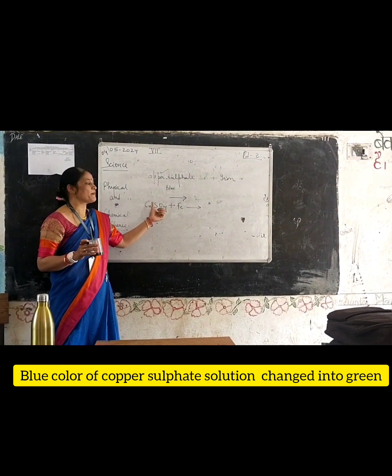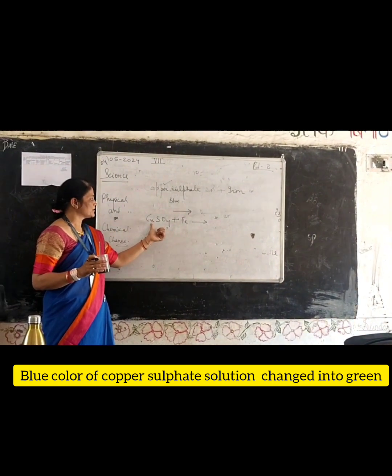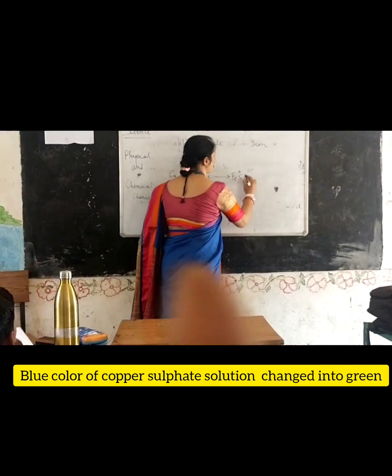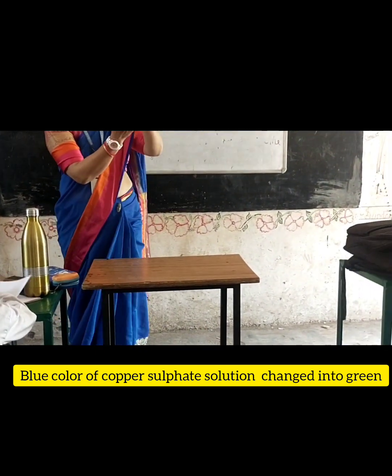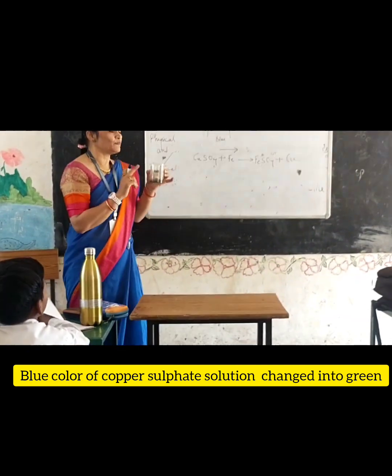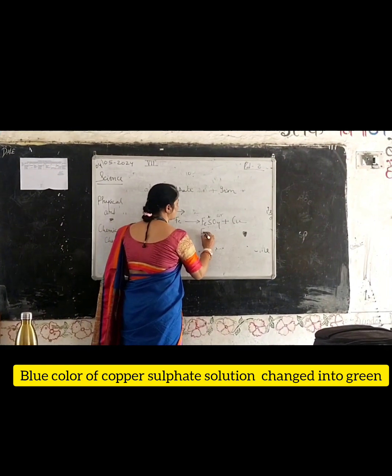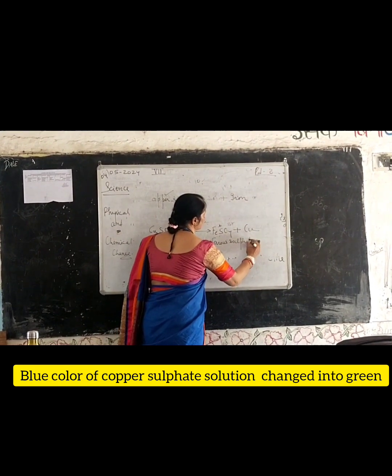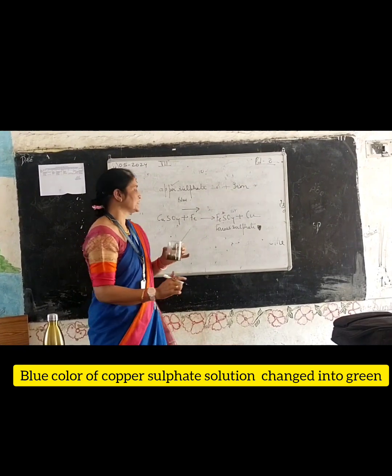Fe will come in and remove Cu. So what will be formed? FeSO4. So FeSO4 plus Cu is removed. FeSO4 — and what is FeSO4? Ferrous sulfate. What is the colour of ferrous sulfate? Green.